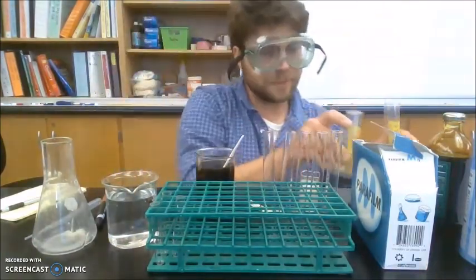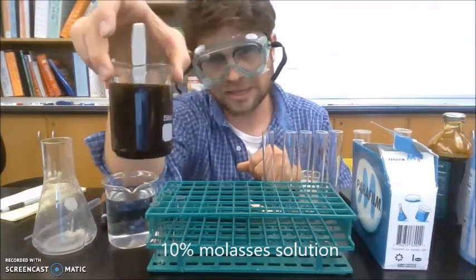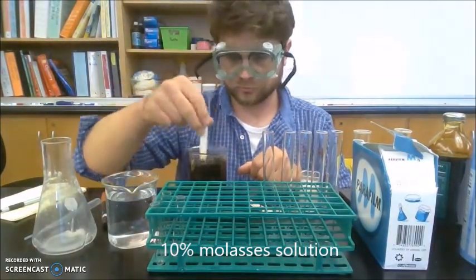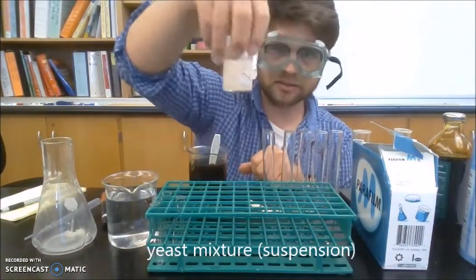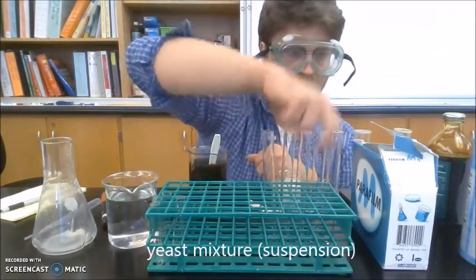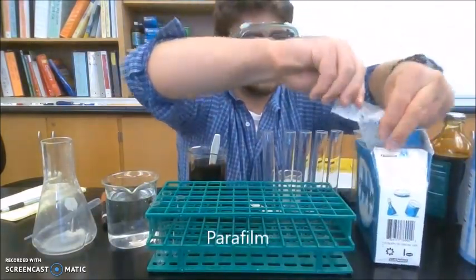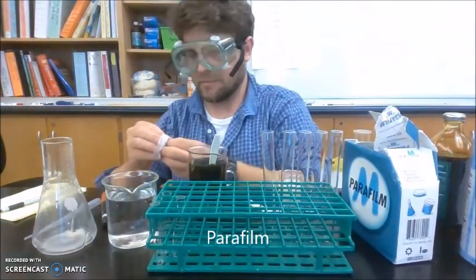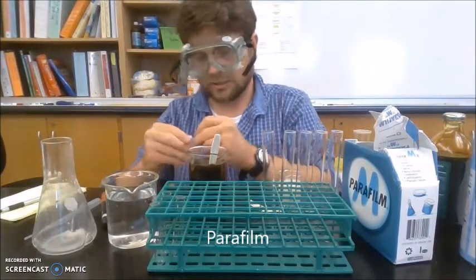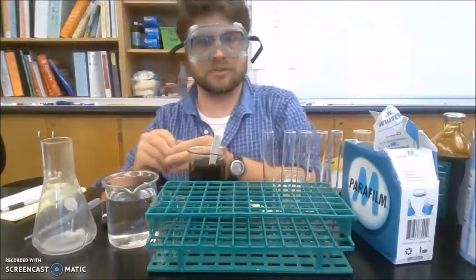I'll be using 2. I have my 10% molasses solution. I have a suspension of active dry yeast. I have parafilm. Parafilm is scientific grade saran wrap. So it's stretchy and you wrap it around stuff.